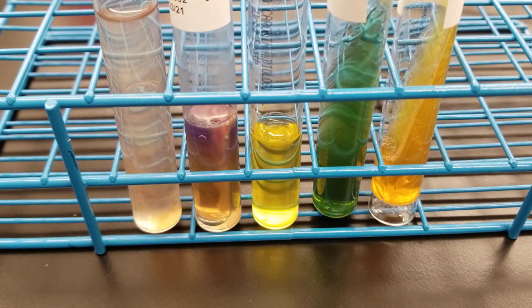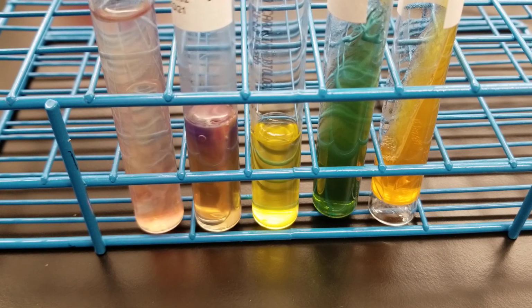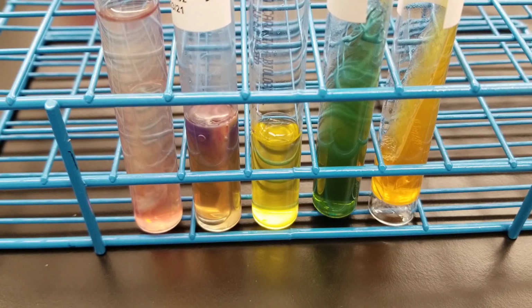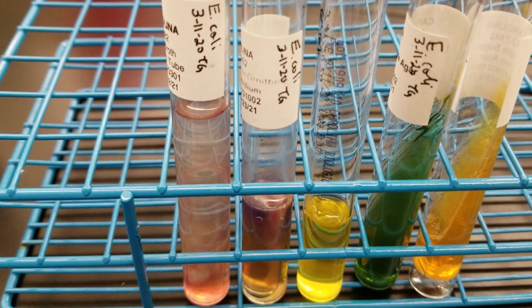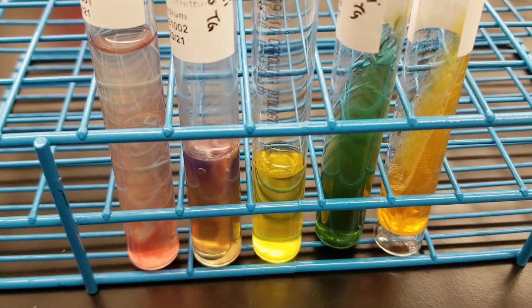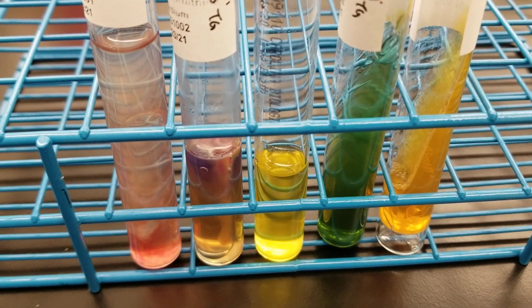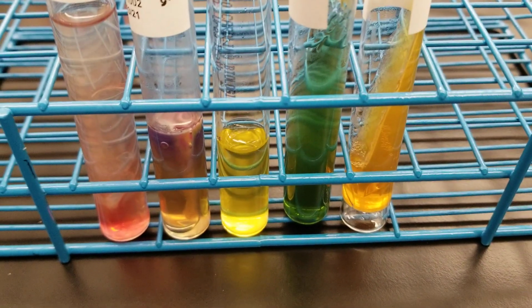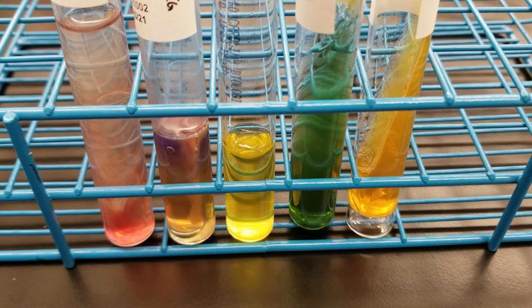And we are waiting for 3 minutes to see a color change, but you already see that it's turning red there, so this is going really well. See that beautiful red? That's not even a minute yet. It was only a few seconds, so that's perfect. So this is what you should see for E. coli. These are our stock organisms currently right now.